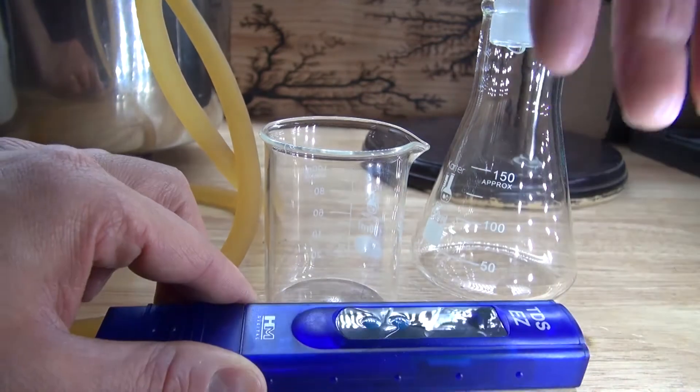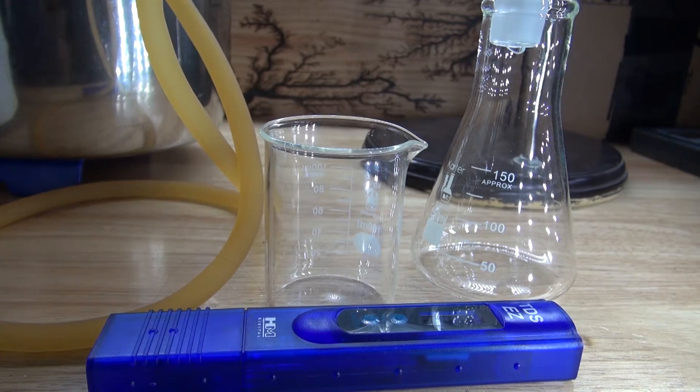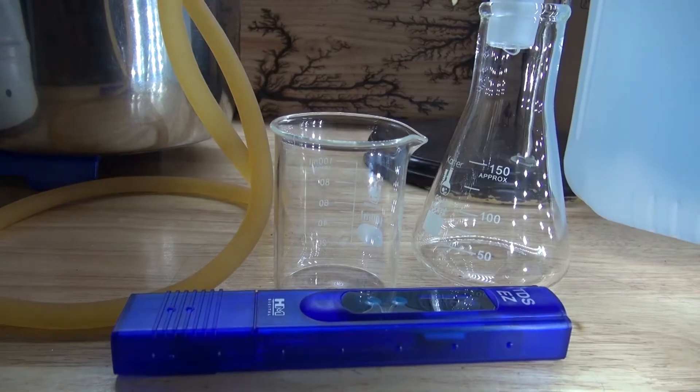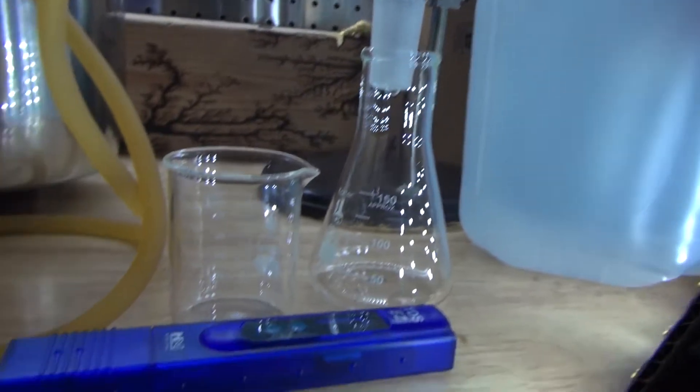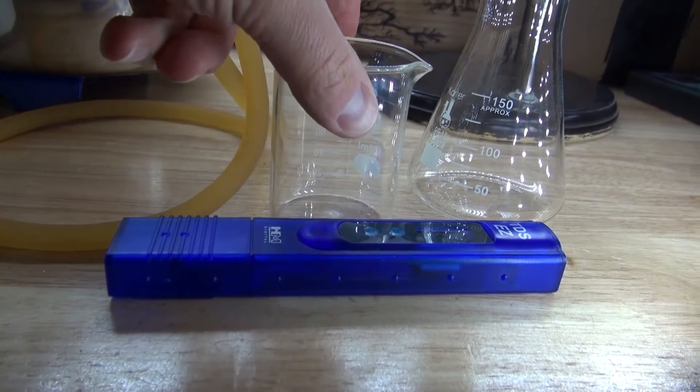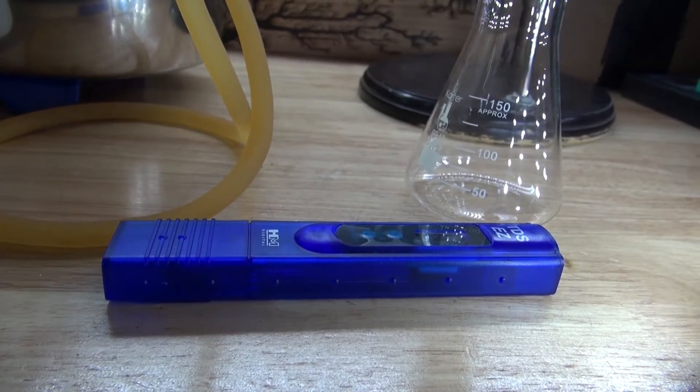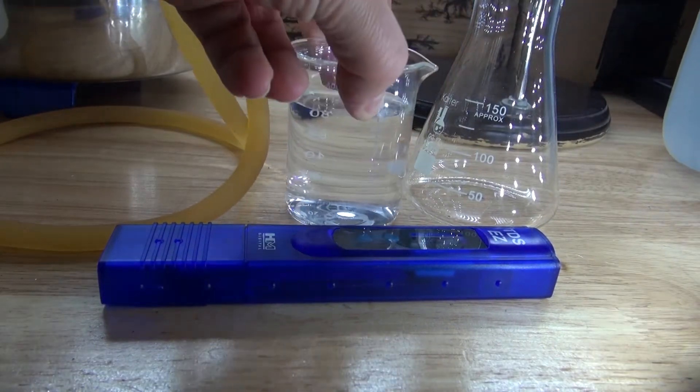I want to see if I can make pure distilled water from regular tap water. I have right here in this jug pure distilled water that I bought from the grocery store and I want to see how pure the commercial brand really is. I'm going to pour some of it inside of this beaker.